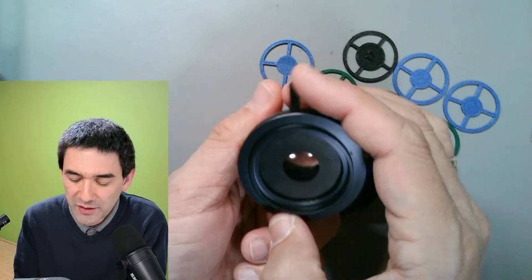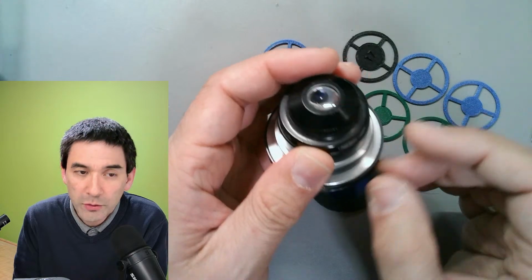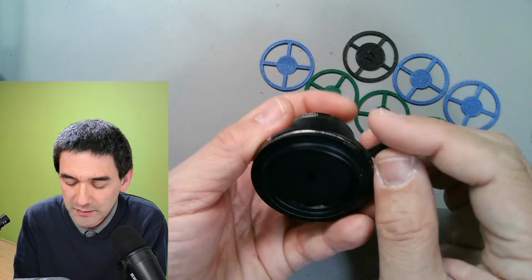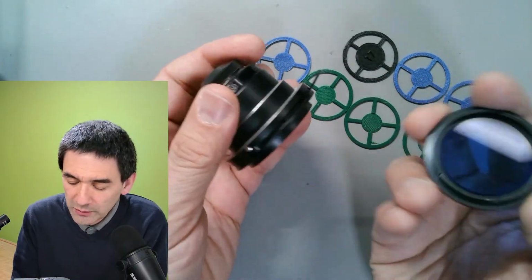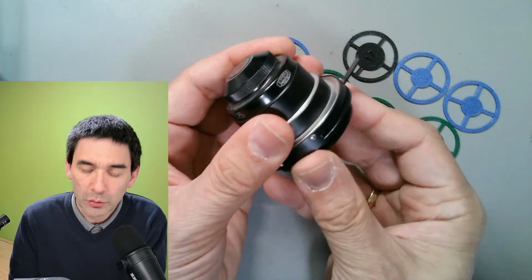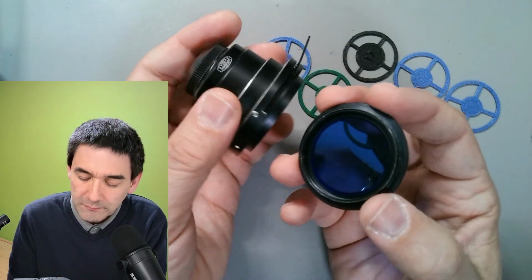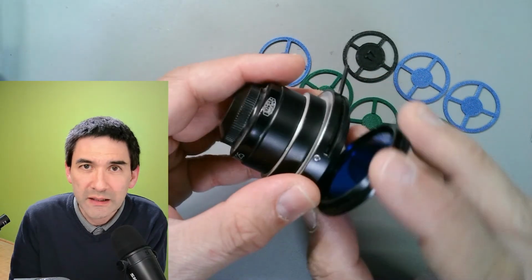And this here is of course the diaphragm, for controlling the numerical aperture, the contrast, and depth of field. So that is essentially a filter holder. However, this filter holder has a little disadvantage for our purposes because it's a push-on filter holder. The one that I have next on my table is actually a swing-out filter holder, the one that I'm going to be using today. The filter holder is connected with a tiny screw, and then it's able to rotate out. And that's actually what we want because we have a little bit more control.